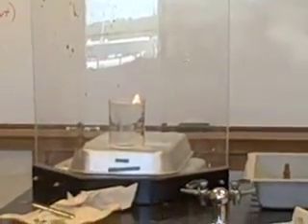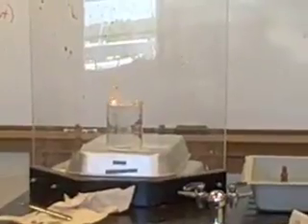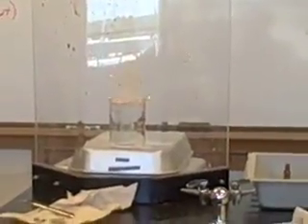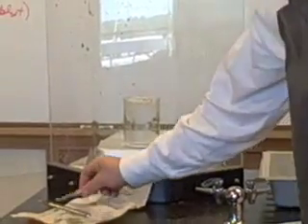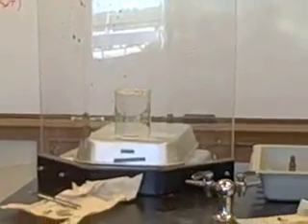All right, here's potassium. Dang, didn't even have to light it. That was intense.